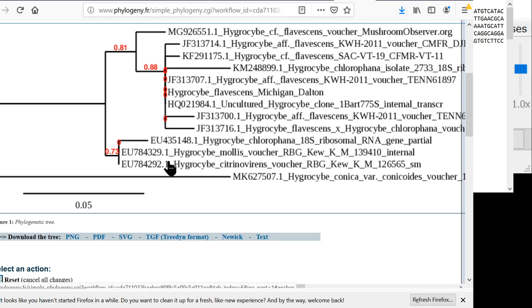One thing that we can see is that Hygrocybe mollis and Hygrocybe citrinovirens are the same species. They got the same sequence because they're exactly the same right here. And then this one, chlorophana, branched off from that. At least that's how the mathematical algorithm thinks that these things all evolved. So this is an algorithm called maximum likelihood. And then here, these numbers are bootstrap support.